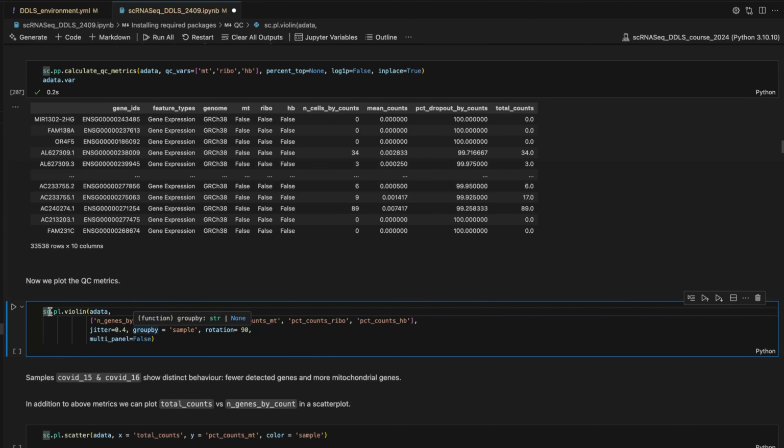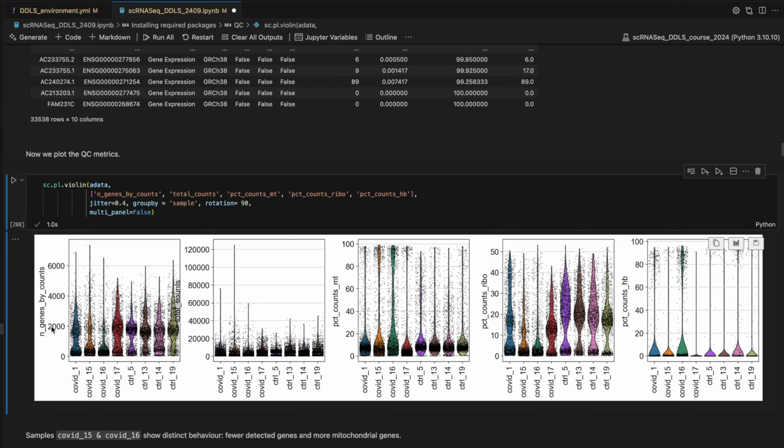We can use violin plots. So the violin function, the object and the features that we are interested in, some settings in order to see the distribution of the cells across the violin distribution, and then we group by samples, rotate the labels by 90 degrees, and we don't want to have it as multi-panel, just in one single panel. There we go. So genes by counts, here we have a slight shift, but what we have here is total count corresponding to total UMIs, and then we have the percentage of mitochondria, percentage of ribosomal genes, and hemoglobin.